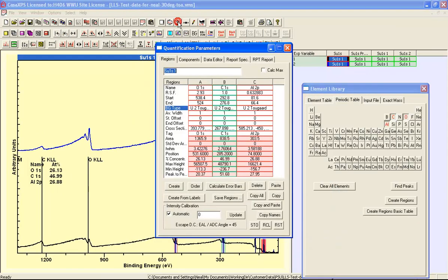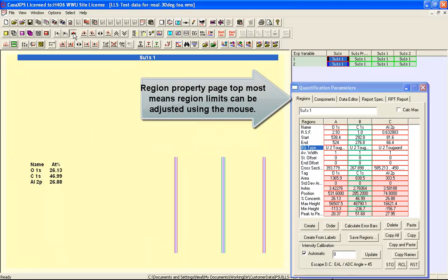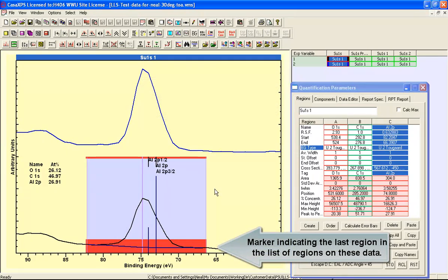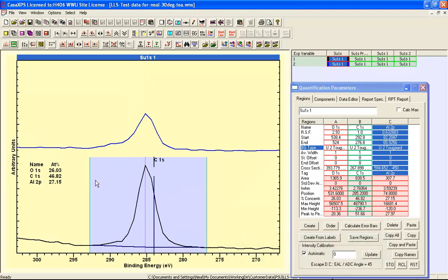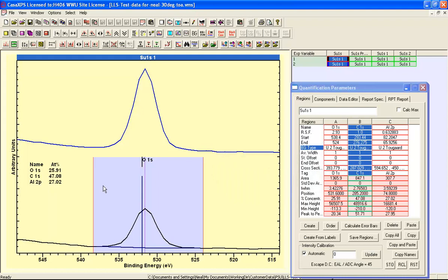So let's bring up the quantification parameters dialog window so that we can make adjustments if necessary. So I'm going to step through, and just looking at both of these spectra at the same time, I'm just making adjustments to the regions so that I get appropriate regions for each one of these three peaks.